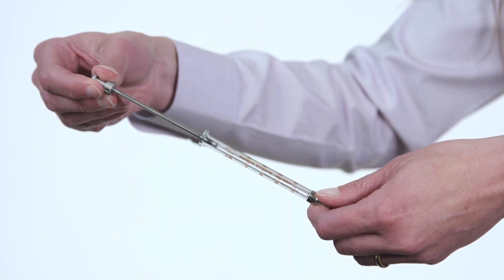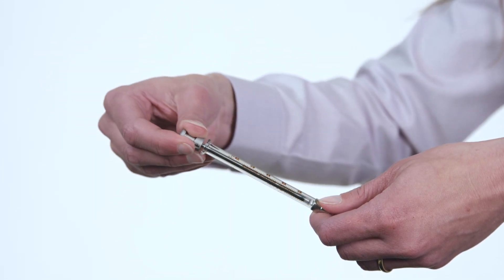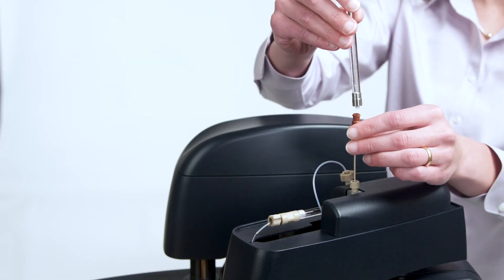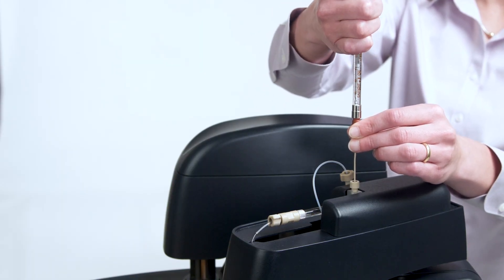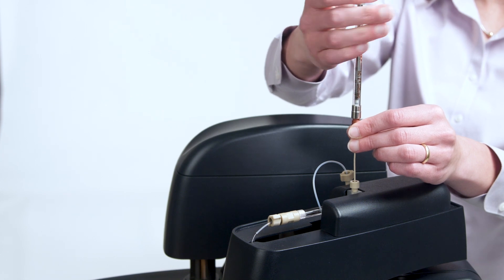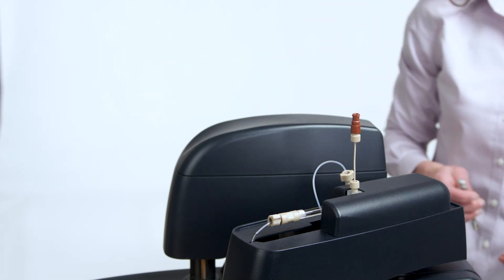After this step, blow air through the injection syringe. This is done by removing the filling syringe and pulling air through the entire volume. This air is used to blow out the titration syringe. This air purge will enable a clean load without breakage of the sample.